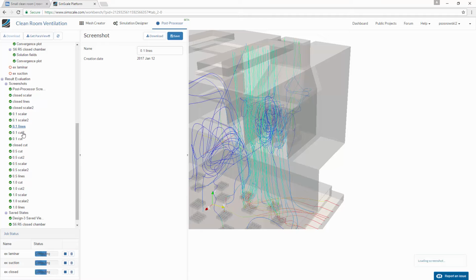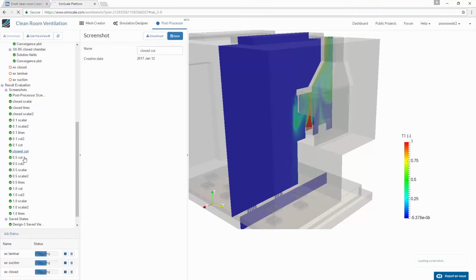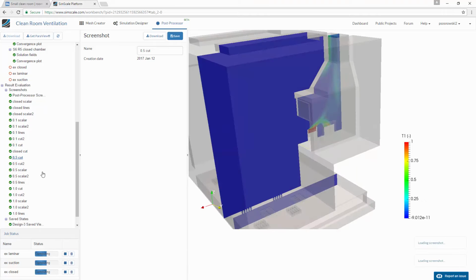The rotating part, so the scalars, and the cut. This signifies that if we put the suction at 0.1 meter per second, we might experience some exiting amounts of the gas, and this shows that this is not a sufficient suction to provide a safe operation for our scientists. So we go next, we see half meter per second, and right now the velocity fields look much better. It seems as if the contaminants do not exit through the windshield.